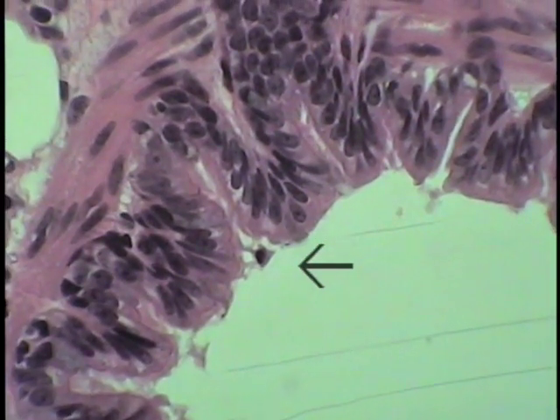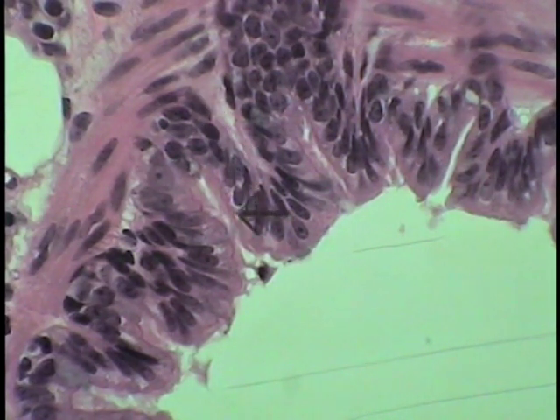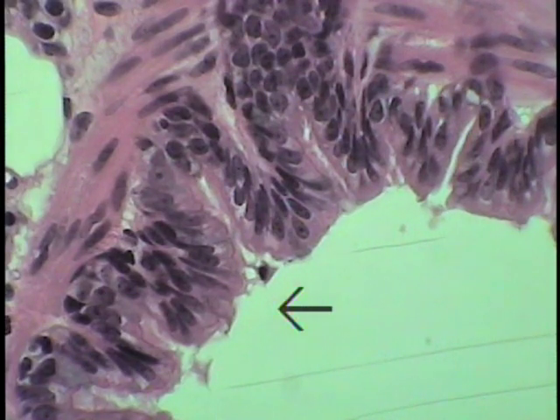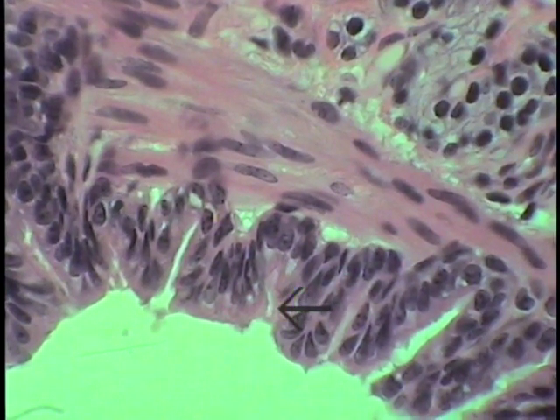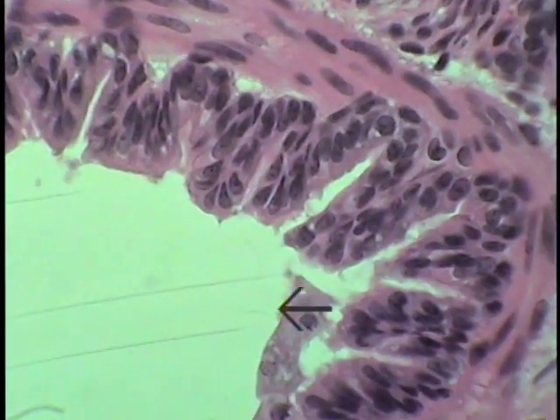So this illustrates quite well how the epithelium is thinning out, becoming a simple columnar form. The cilia are retained at this point, but the goblet cells are much less frequent in number. And of course the bronchial muscle retains its prominence and will become a major supporting element of the bronchiole wall.